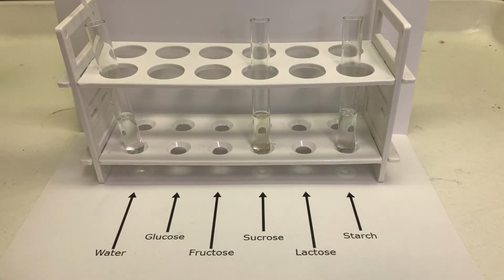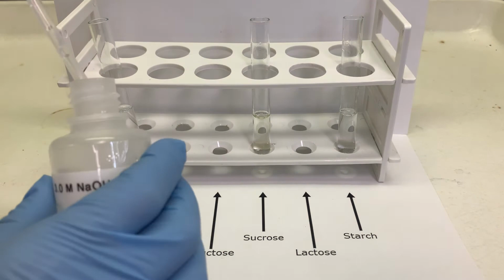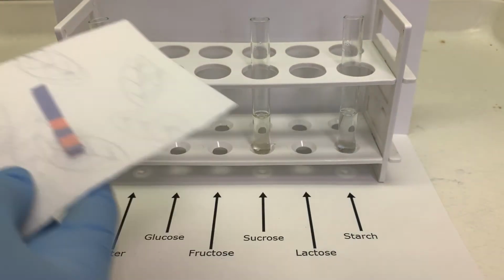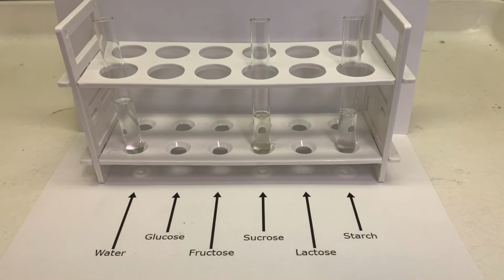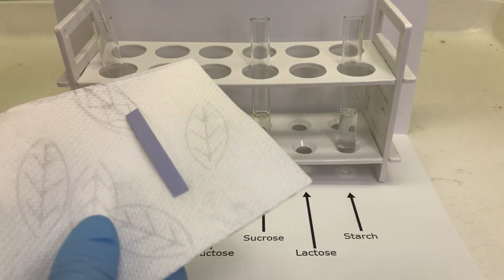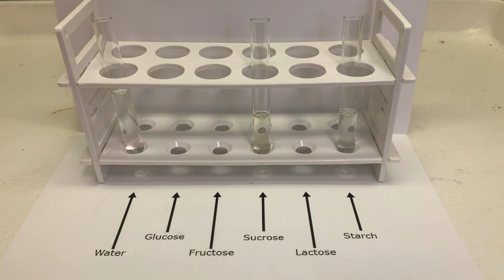The next step is the most time-consuming. We now need to neutralize the acid using sodium hydroxide. We don't really want to overshoot the neutralization, so we must continuously check our mixture to make sure that we've added the perfect amount of sodium hydroxide to the acidified carbohydrate mixture. We can verify that we have neutralized our sample by checking it with blue litmus paper. If the paper stays blue, we know we have a basic solution and our acid has been neutralized.